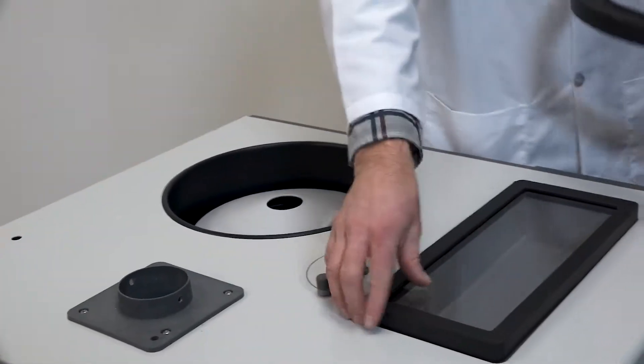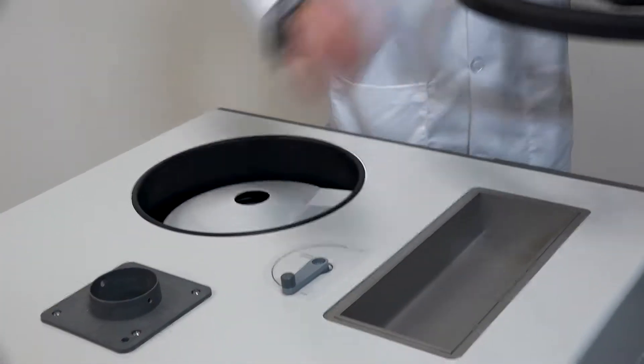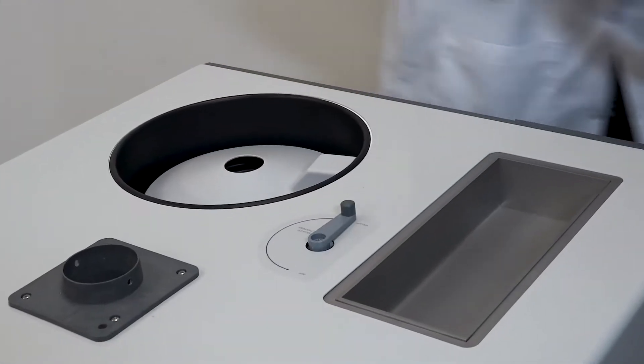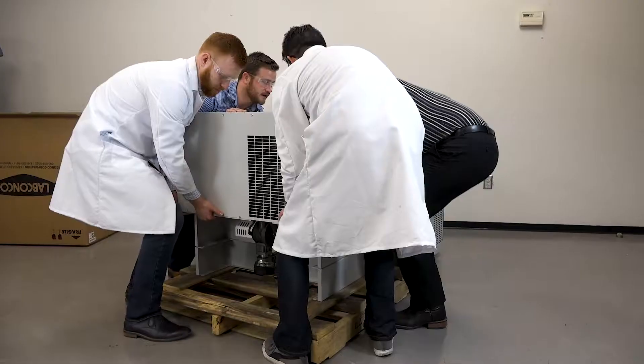Remove all lids, and if you have a mini-chamber, rotate the mini-chamber handle so it will not interfere with the placement of the stopper and tray dryer.